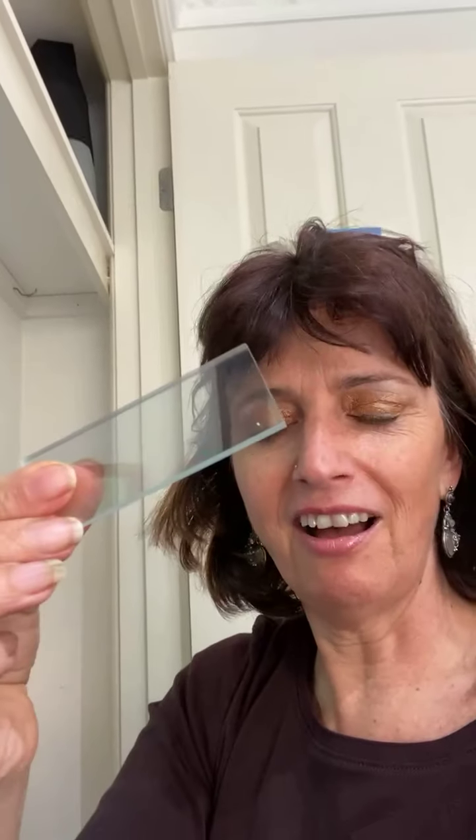How we start is we do all the prep to get their skin ready and the slide ready, and then we take one of these little lancets and prick the skin to get a blood drop. Already the way the blood comes out tells us about the quality of the blood and what's going on. We then place just one drop for the live blood on the slides. Let me take one of these little slides and pop it on as quickly as possible.